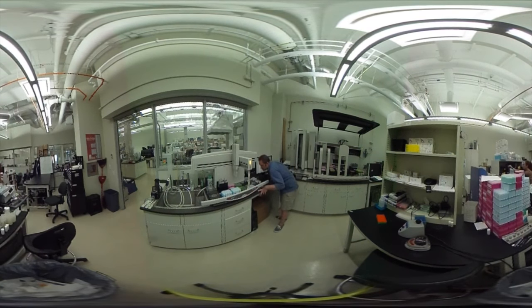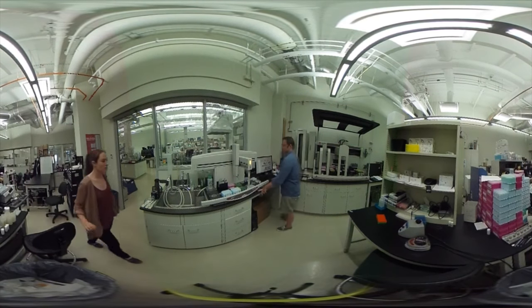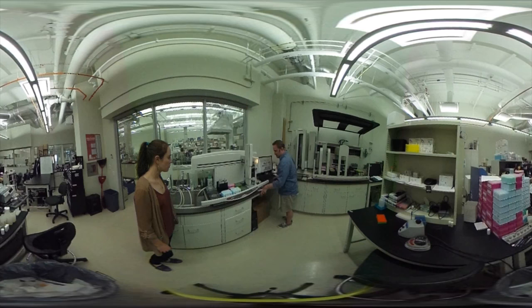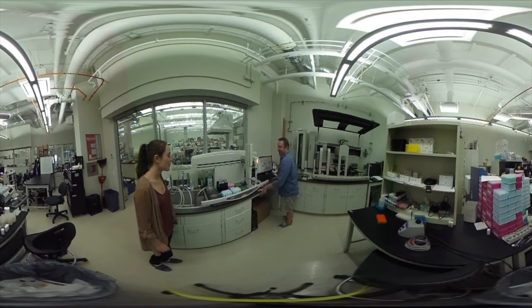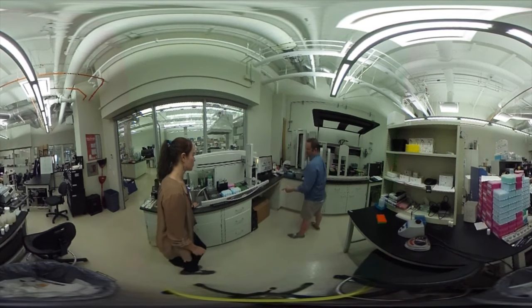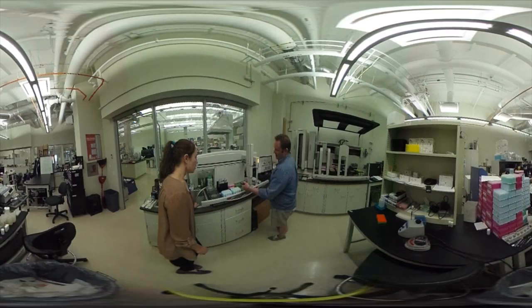The MBSU — the Molecular Biology Service Unit — is fabulous. The people are there to help you, and it's remarkable how it brings labs together. There are very few facilities like this around the world that have this kind of interdisciplinary science with researchers collaborating. We have experts associated with the technologies we want to use right on campus — we can pick their brains, ask questions, and learn how to use the different technologies.